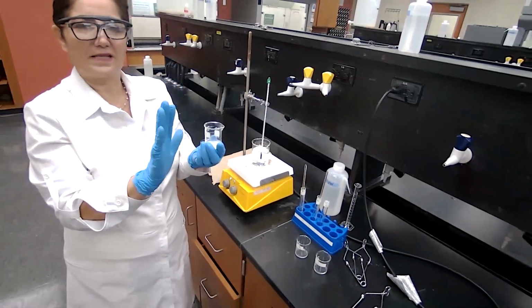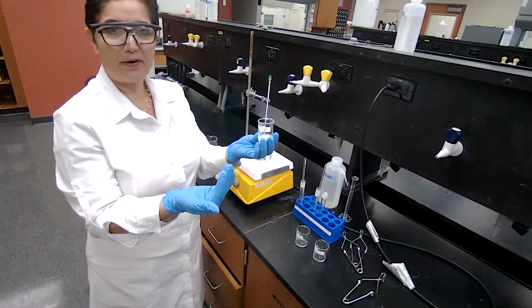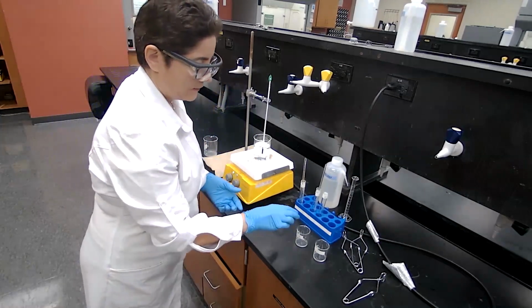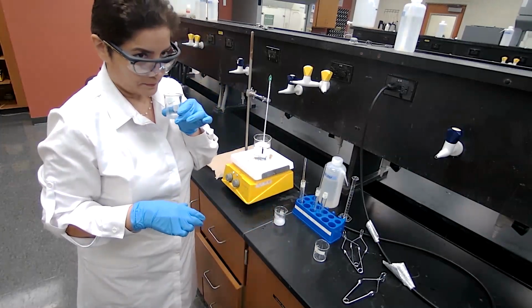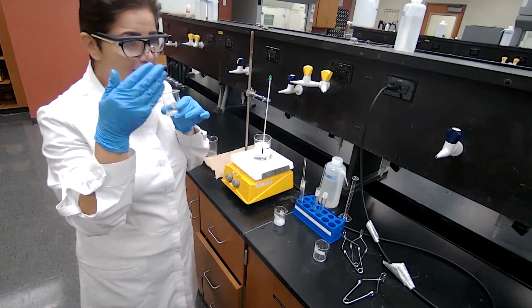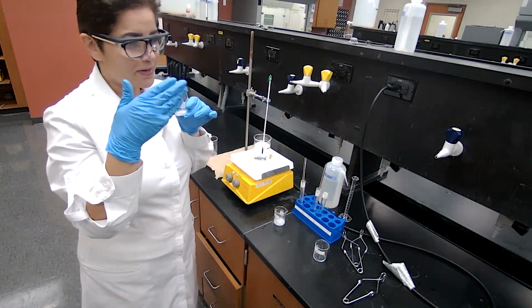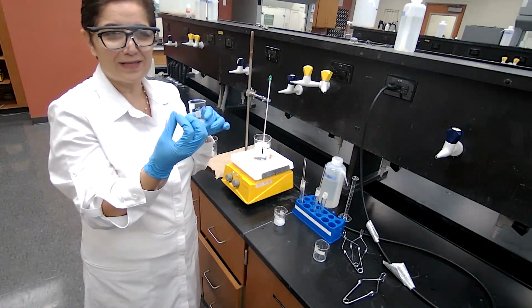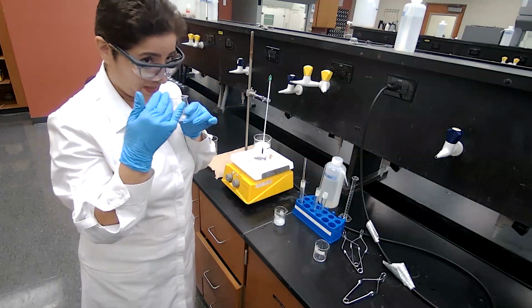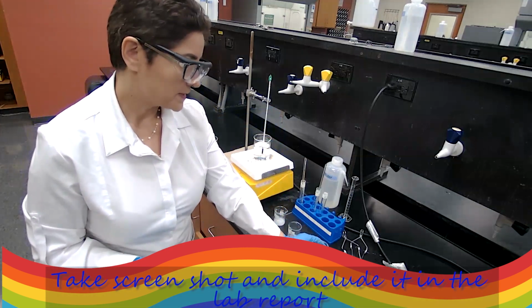So definitely it smells like wintergreen. So you can record your observation, and as I am your lab partner, you can trust me and record this one as wintergreen. For B, the smell is like cherry, and I can smell the cherry because I used to pick cherries from the trees, and I know how that smells. It might not be easy to smell cherry, because you can taste cherry very well, but definitely to me, it smells like cherry. So you can record your observation for B as the smell of cherry.